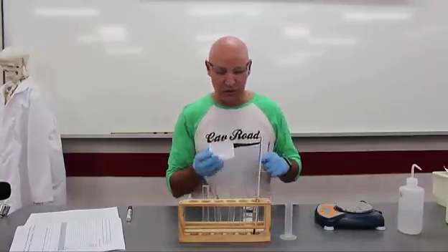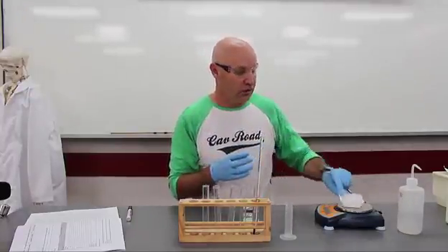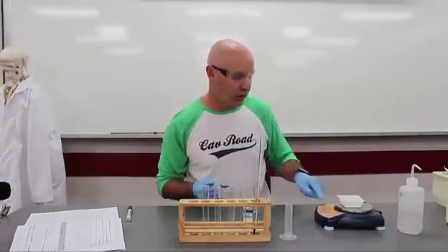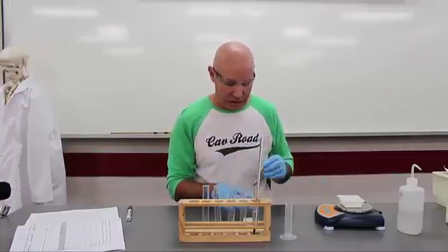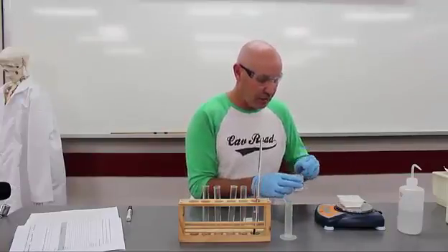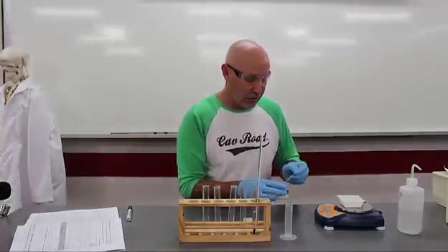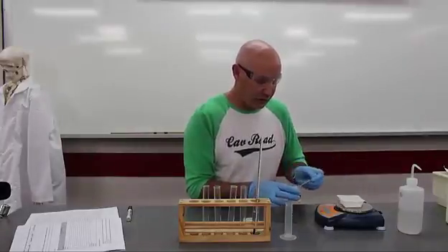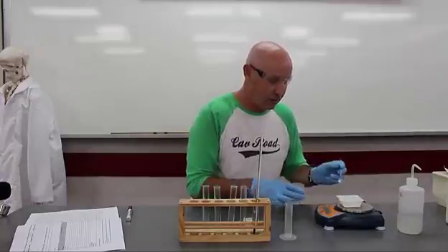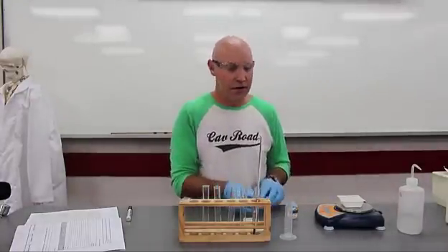Now, we're going to put the ammonium nitrate on a weighing boat before we put it into our test tube. So you put your weighing boat on the pan balance first, and then very importantly, you need to zero it or tare it. And we're going to use 5 grams, so just a little bit to start off with, and then adding a bit more. This is accurate to 2 decimal places. And that's exactly, in fact I've gone too far, it can sneak up on you fairly quickly. Okay, and so that now is exactly 5 grams.